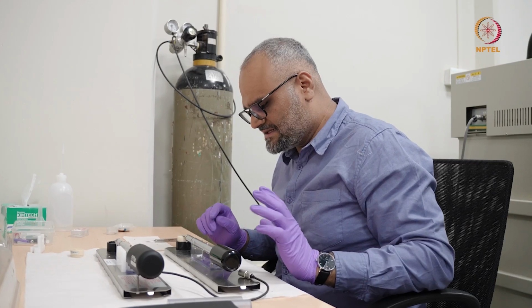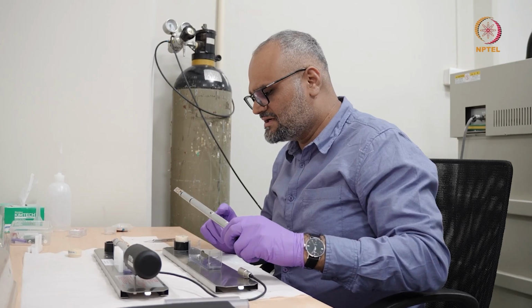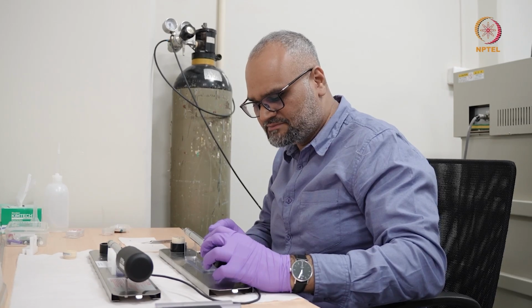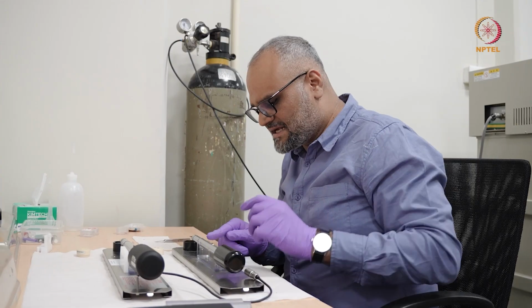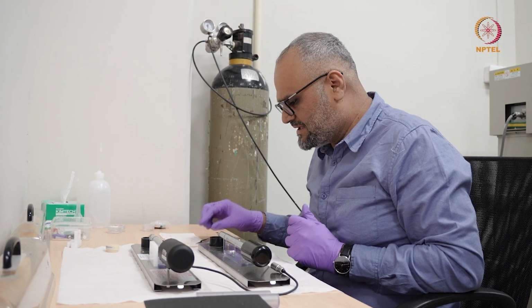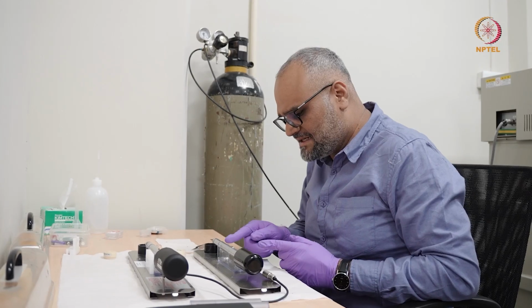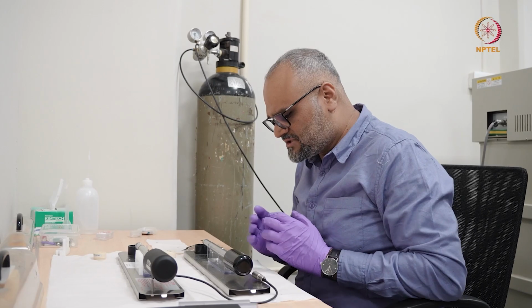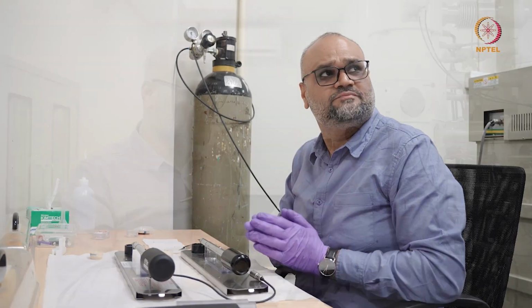And then another practice which we usually have is, after you load the specimen into the holder, it is generally a good practice to give a gentle tap and check if the specimen is sitting properly. Once this is done, you also check if there is any contamination near the O-ring, which is over here. Usually, when the holder is lying outside for very long, it is possible that you collect some dirt particles, and any dirt on the O-ring will also interfere with achieving a good vacuum in the microscope column. So once your O-rings are clean, your specimen is loaded, you can load this into the microscope.